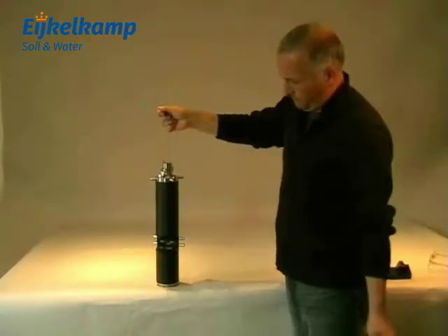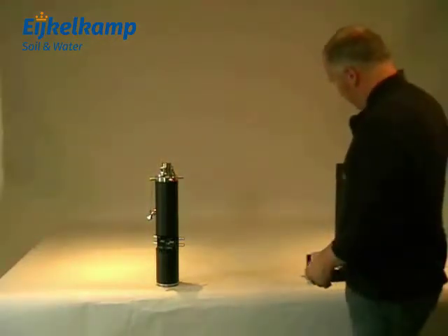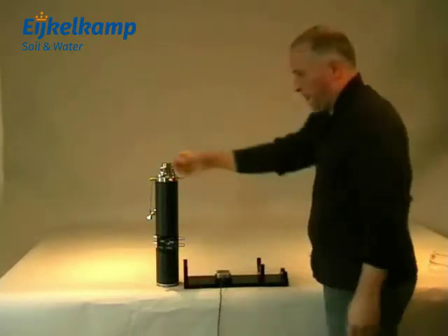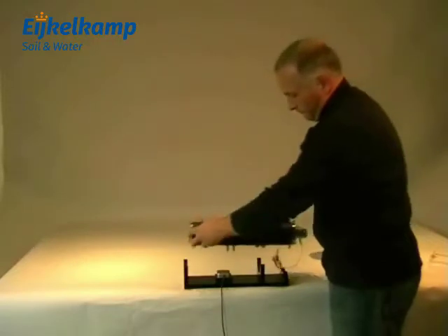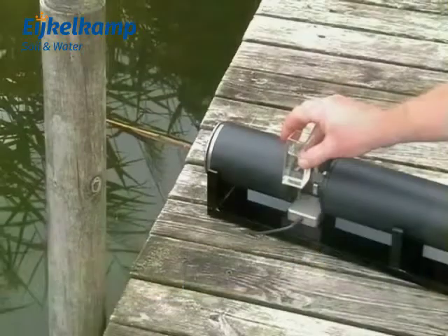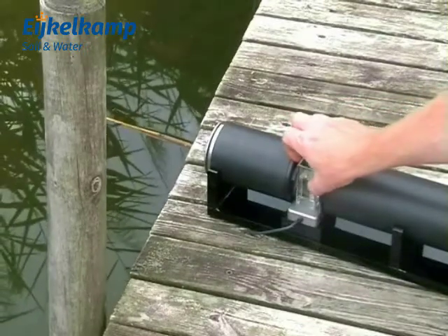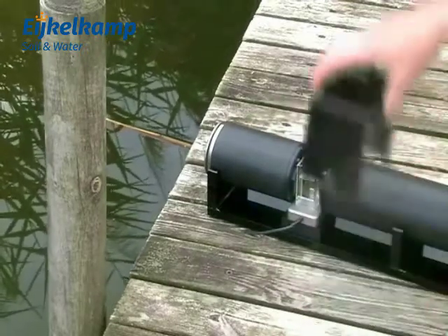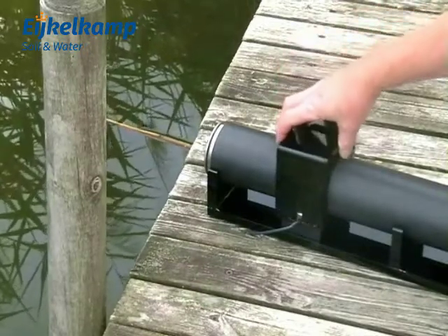The instrument can also be used as a portable cuvette device. The probe is simply removed from its casing and placed onto the holder. The sample is measured after being taken from the water using the 25 mm glass cuvette, which is placed in the opening of the probe. The probe is then covered to exclude interference from outside light, which can affect the measurement.